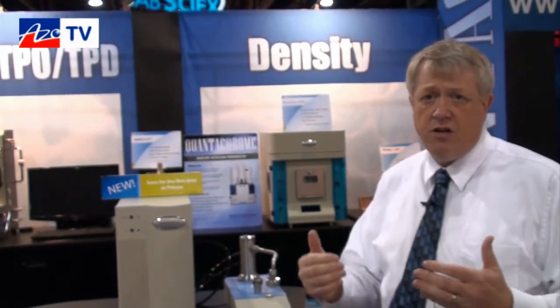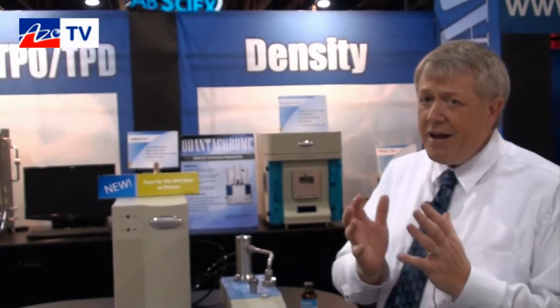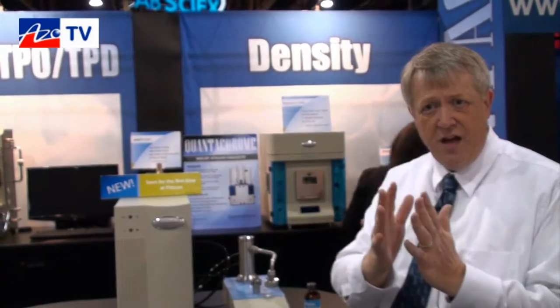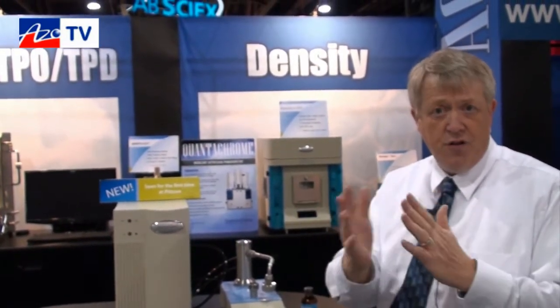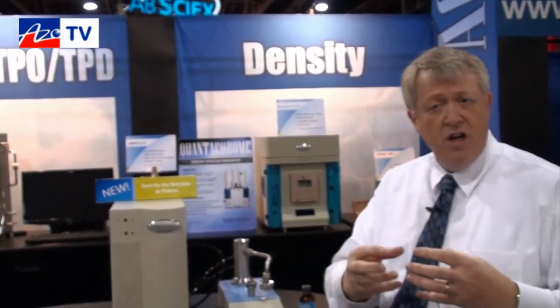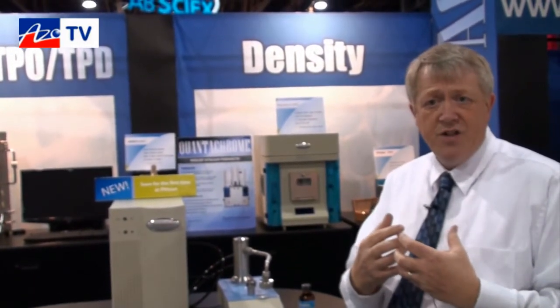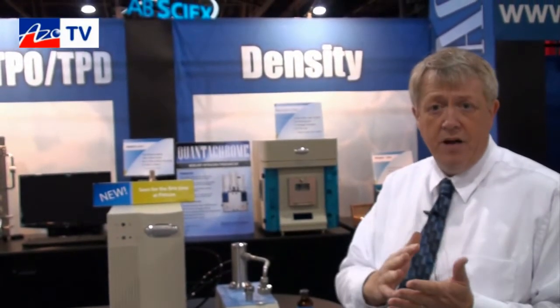For example, battery separators — these non-woven polymeric materials — you've got to make sure that those battery separators can allow proper exchange of electrolyte through there, but not allow solids to migrate through that separator. So you've got to make sure that there are no large holes, and even that the strength of the membrane-type material or textured fabric can actually withstand a certain pressure differential across that membrane.